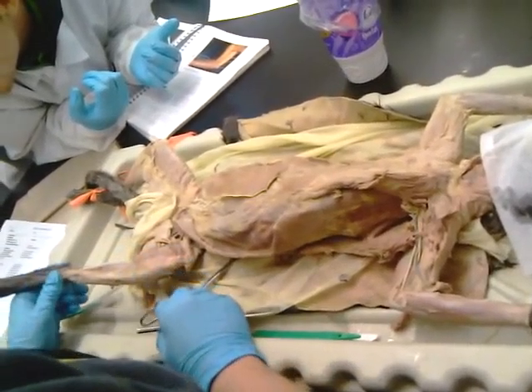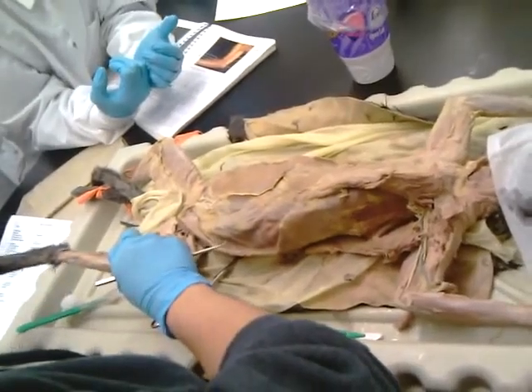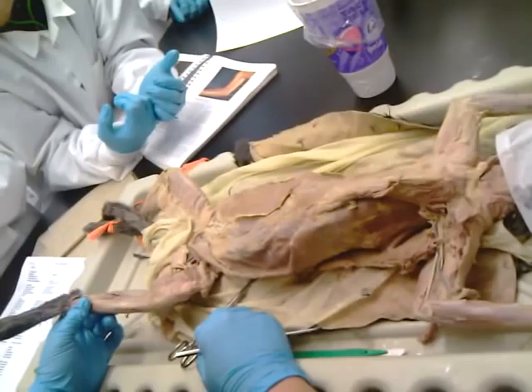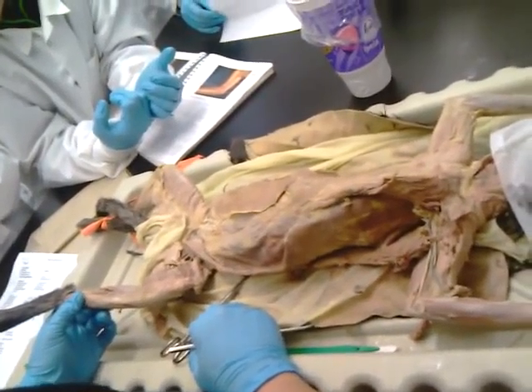So we're looking at my left. Extensor? No, it's going to be flexor. It's underneath, so it's going to curl my toes. So look at your left. Flexor what? Flexor digitorum longus.